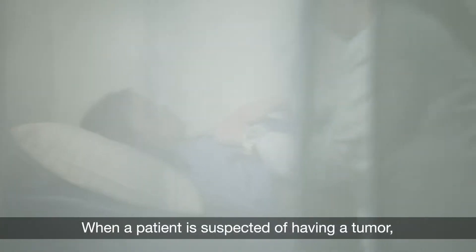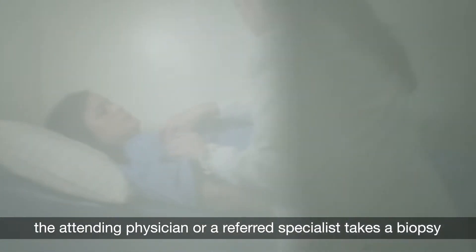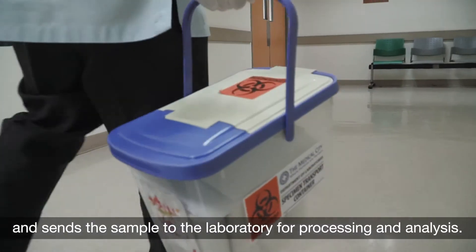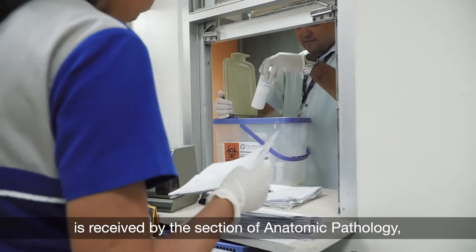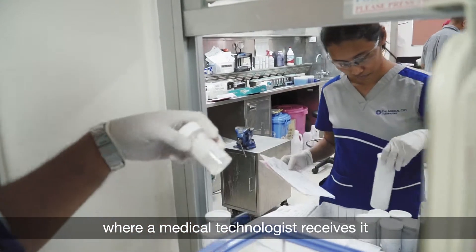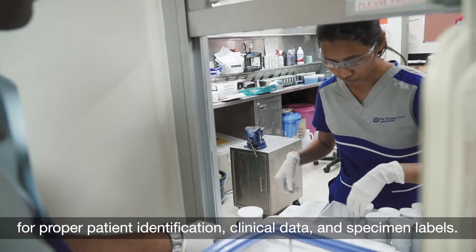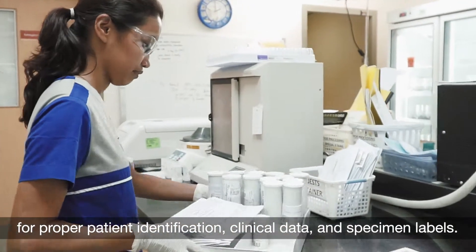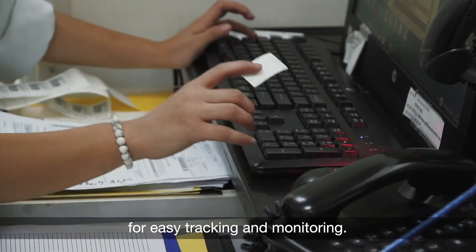When a patient is suspected of having a tumor, the attending physician or a referred specialist takes a biopsy and sends the sample to a laboratory for processing and analysis. At the Medical City, that specimen is received by the Section of Anatomic Pathology, where a medical technologist receives it and first checks the container and request forms for proper patient identification, clinical data, and specimen labels. Upon receipt, the specimen is assigned a unique barcode for easy tracking and monitoring.